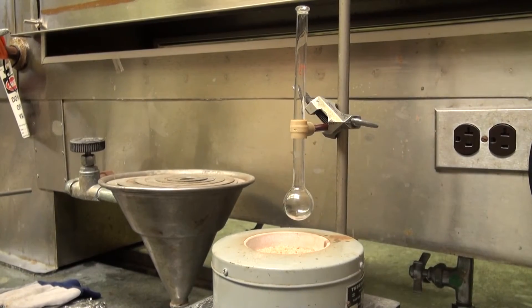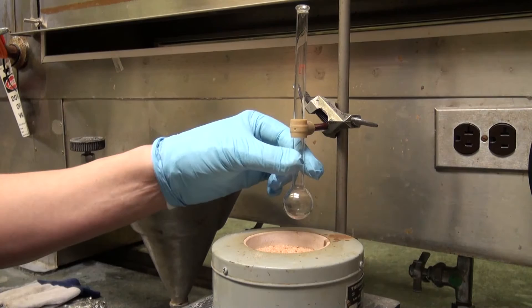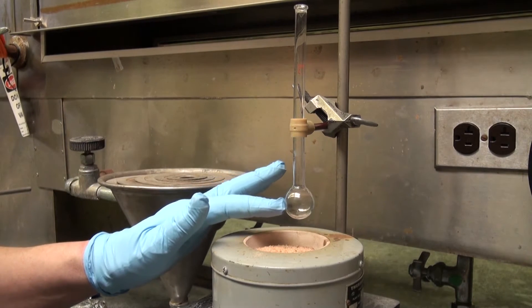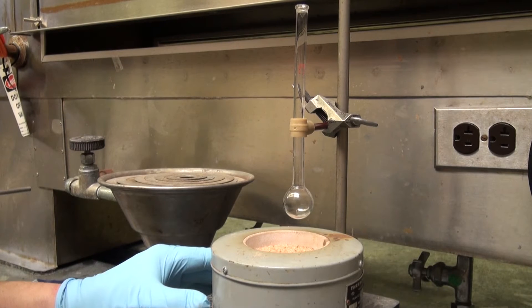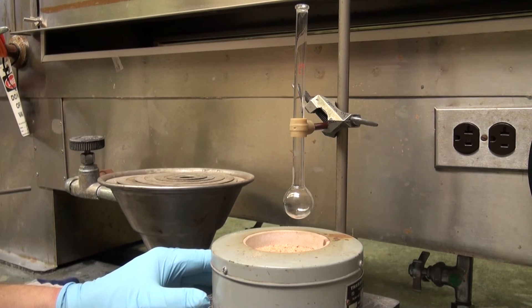This is your apparatus. In order to heat up a solution what you need to have is of course your solution, the reaction mixture with a solvent if you need solvent, and you need a boiling chip.